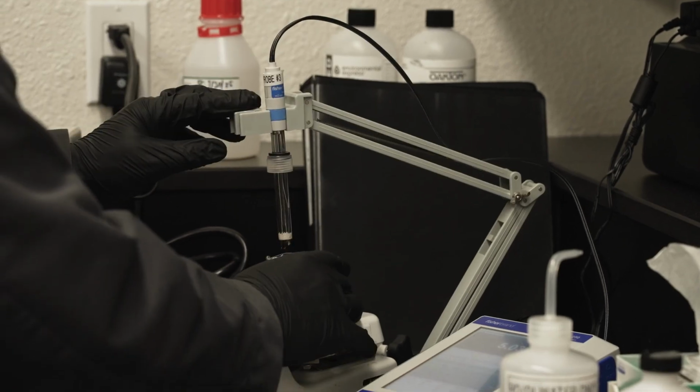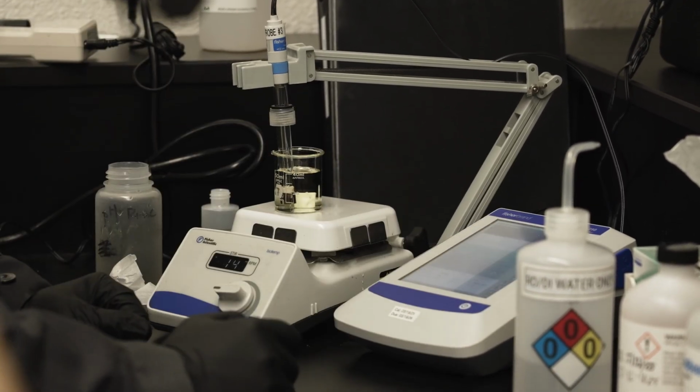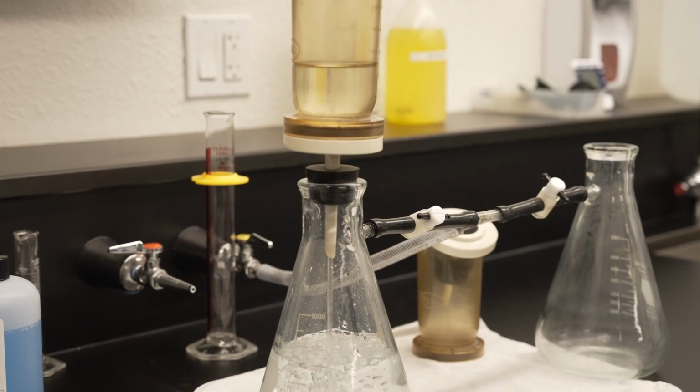Things like bacteria levels, amounts of solids, and the amount of disinfectant in our contact channels can change quickly day to day, so we need to test for those more often. One of us here is testing for something 7 days a week or 365 days a year.